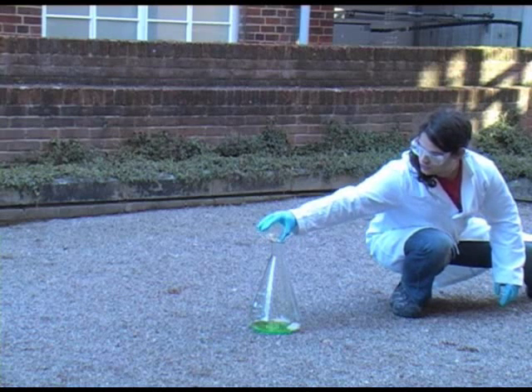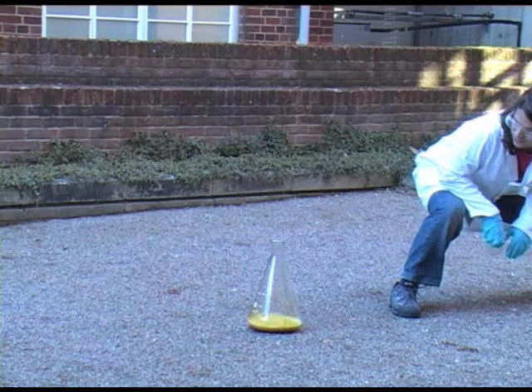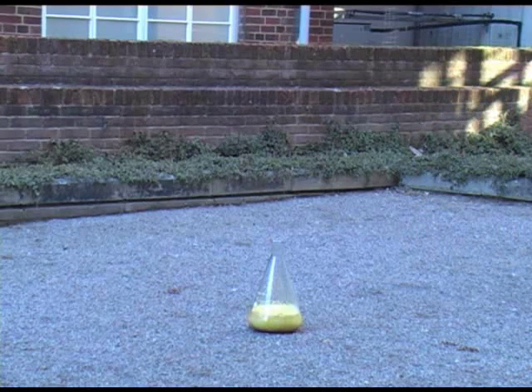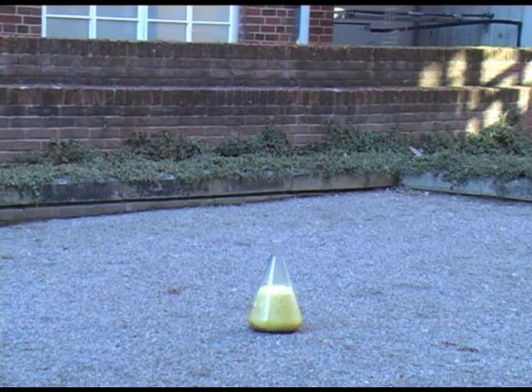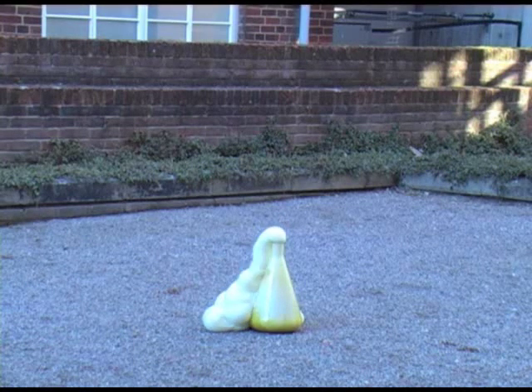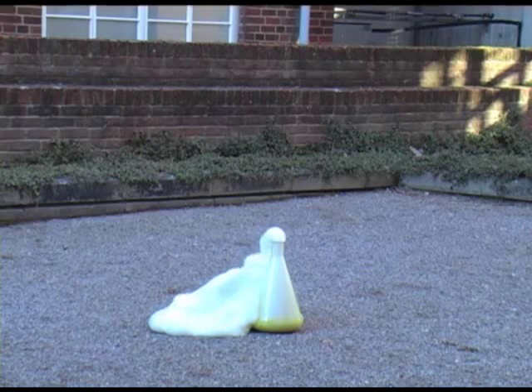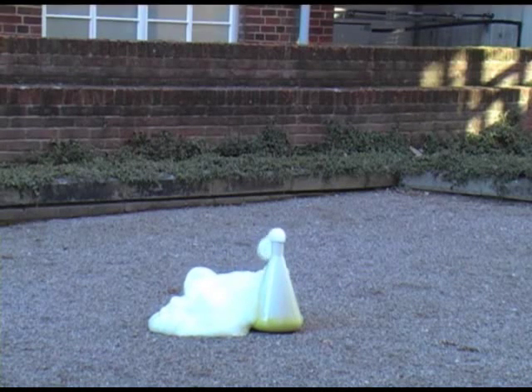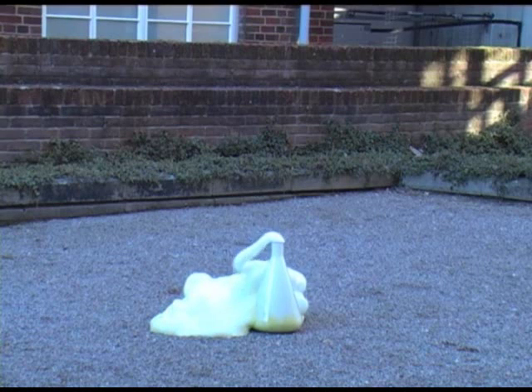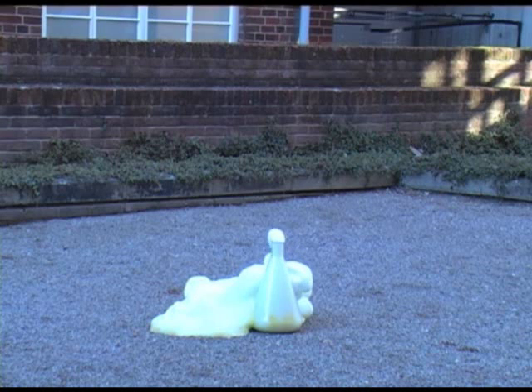Here we see the same reaction with some soap added and on a slightly larger scale. Because of the presence of the soap a foam is produced which shoots out the top of the conical flask. This reaction is affectionately known as elephant toothpaste. Once again the production of oxygen gas is the driving force for the formation of the foam.